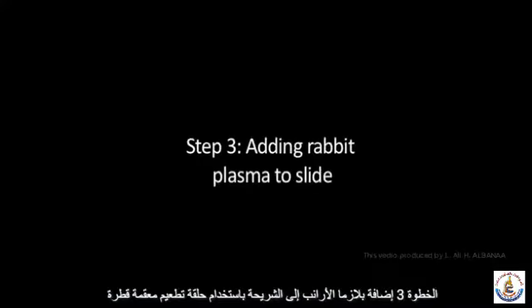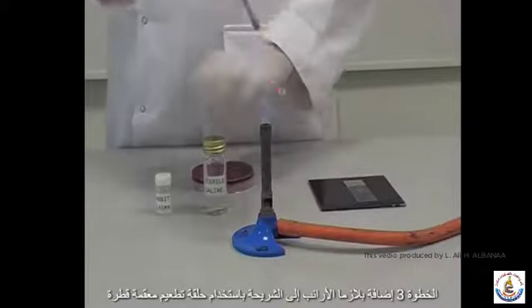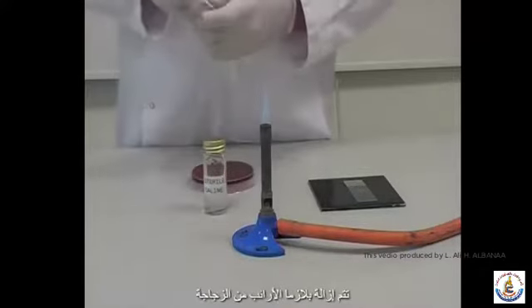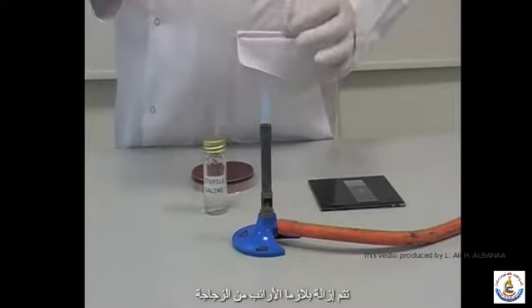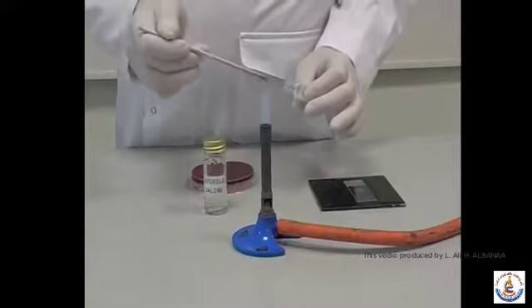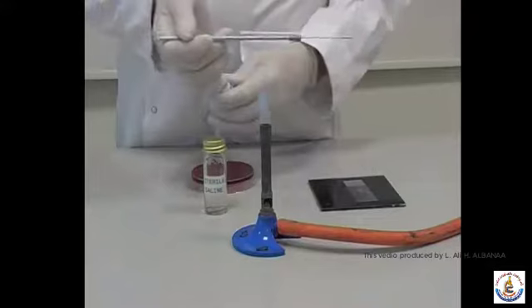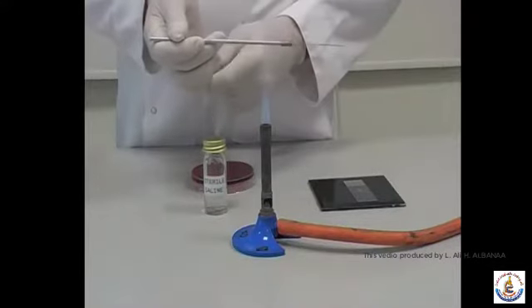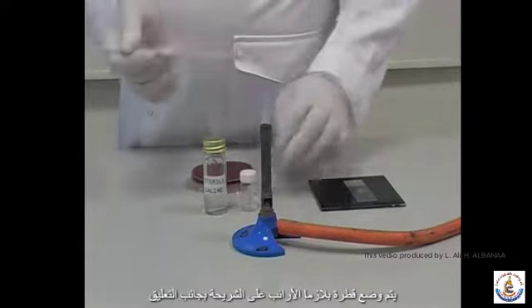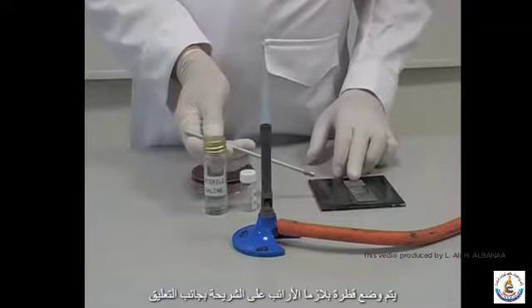Step 3. Adding rabbit plasma to the slide. Using a sterile inoculating loop, a drop of rabbit plasma is removed from a bottle. The drop of rabbit plasma is placed on the slide next to the suspension. The two drops are mixed together a little so that they overlap slightly.